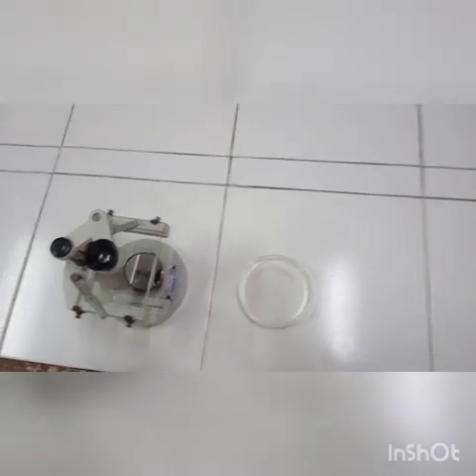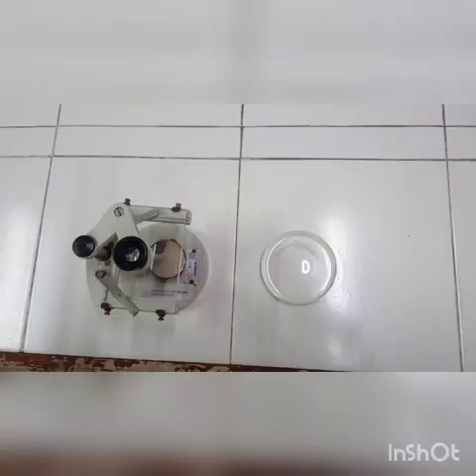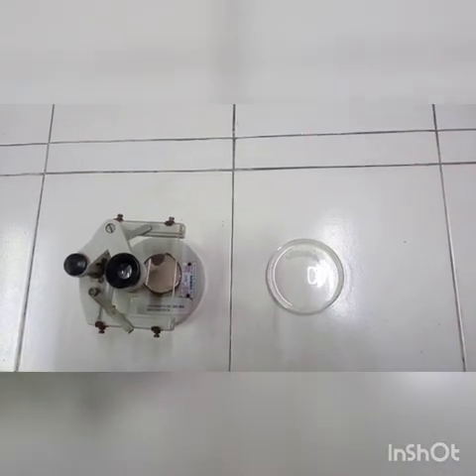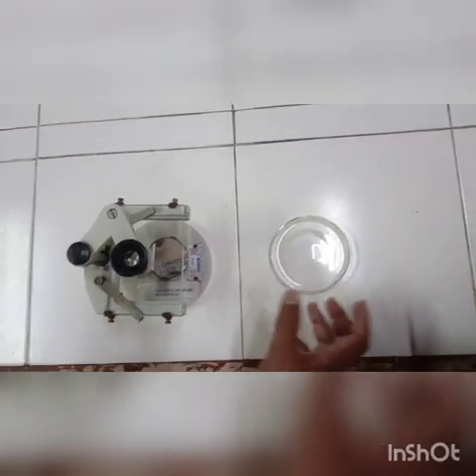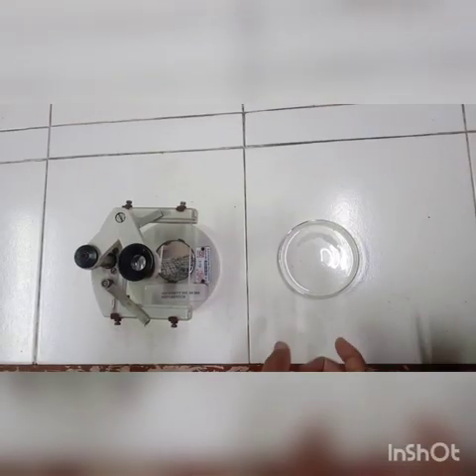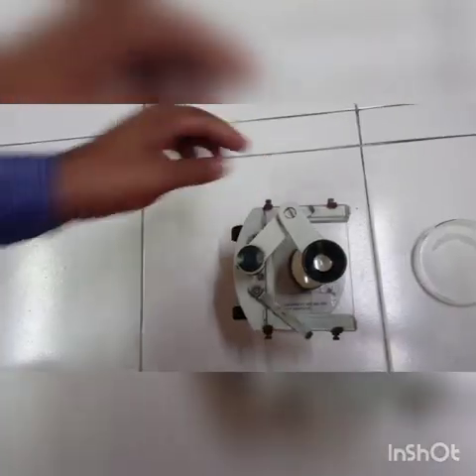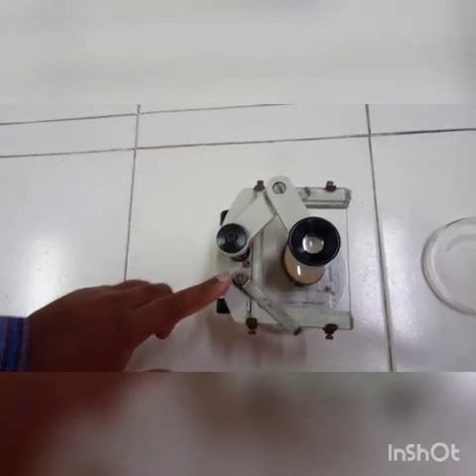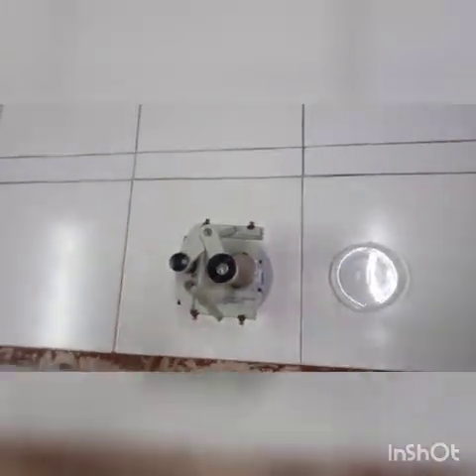Today we are going to look at different stages of embryo, and here I have the different stages of embryos kept in this liquid medium, but you cannot see the actual embryo in it. And with this lab we are going to use a microscope called a dissection microscope, which is a little different from the other microscope.